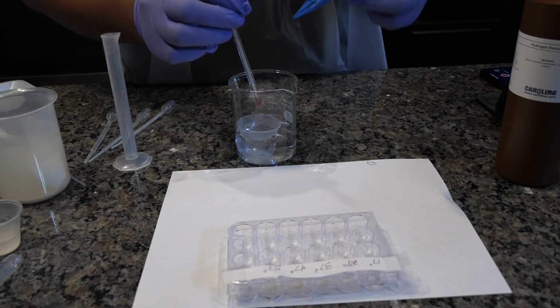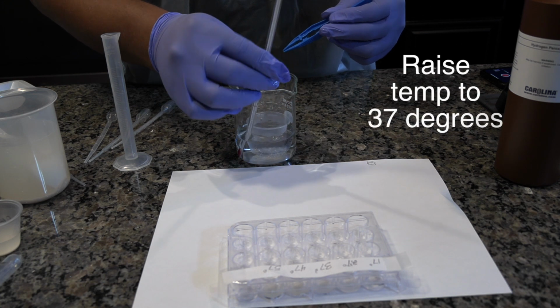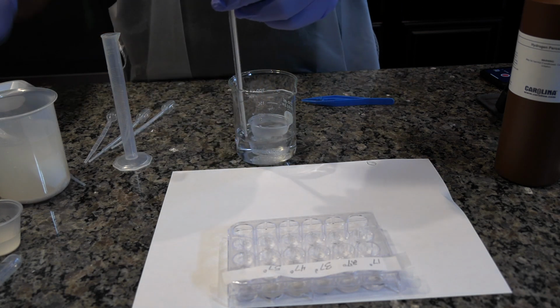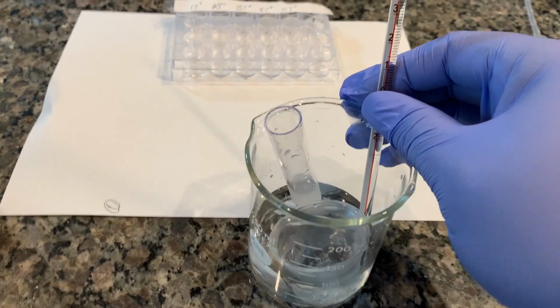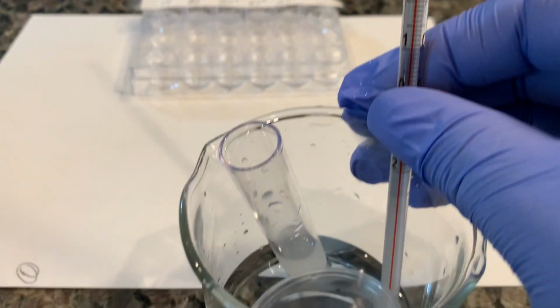Place the medicine cup of the hydrogen peroxide in the center of the beaker. Place the catalase tube in the beaker beside the medicine cup. Wait 2 minutes to allow the temperature of the medicine cup to reach equilibrium with the water bath.